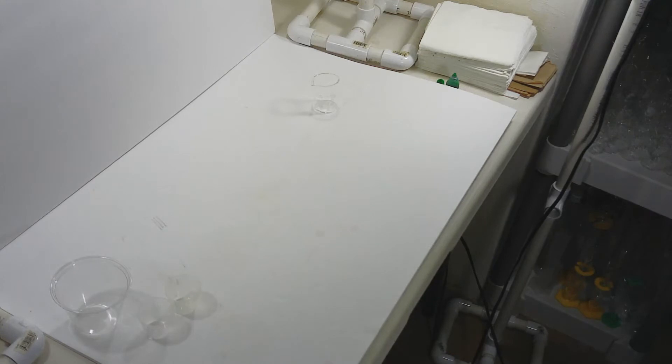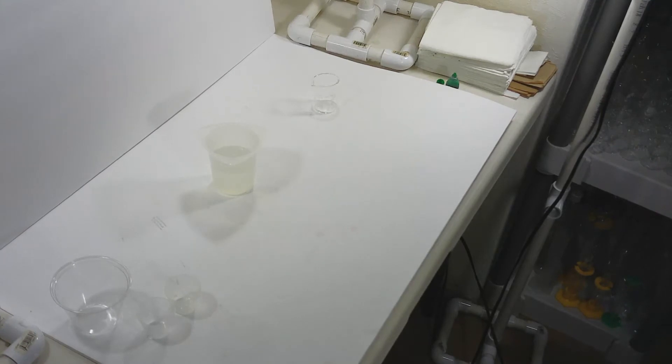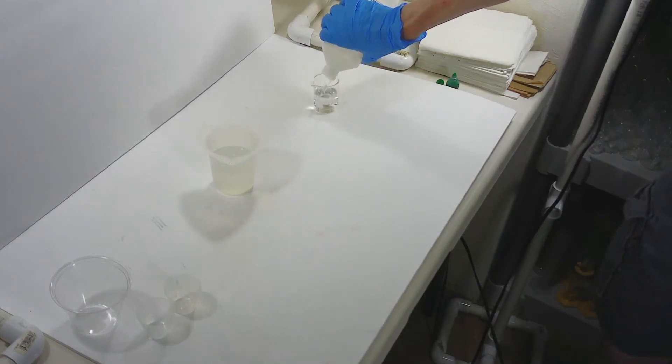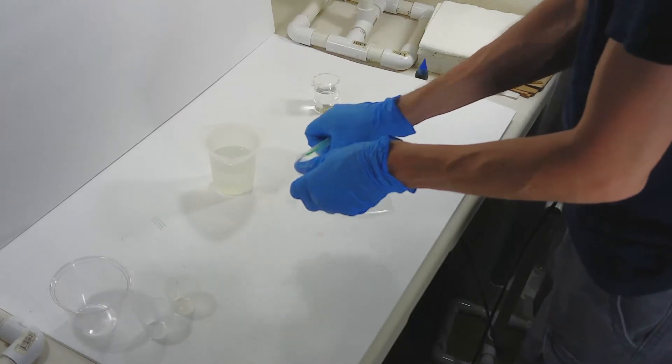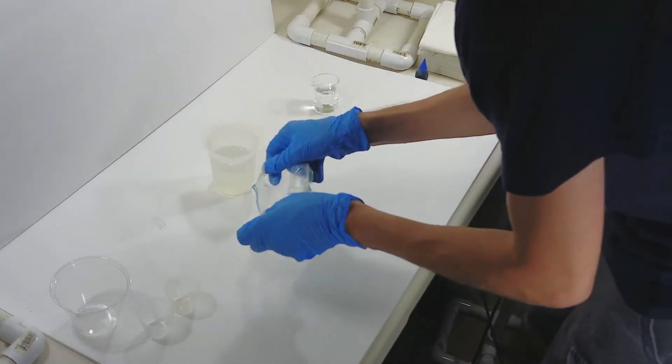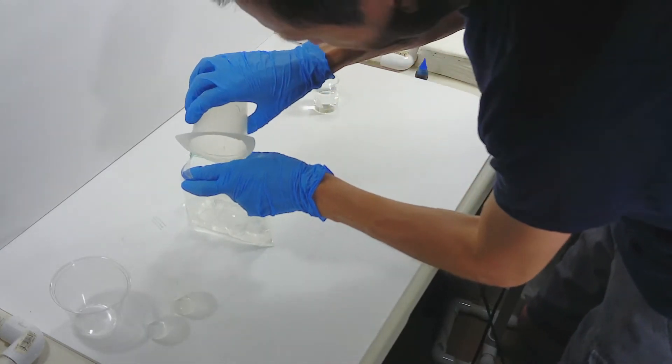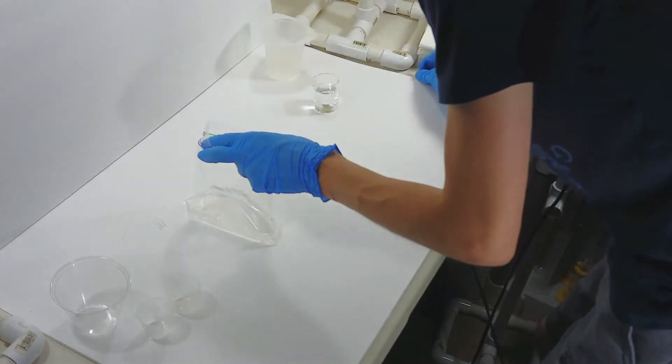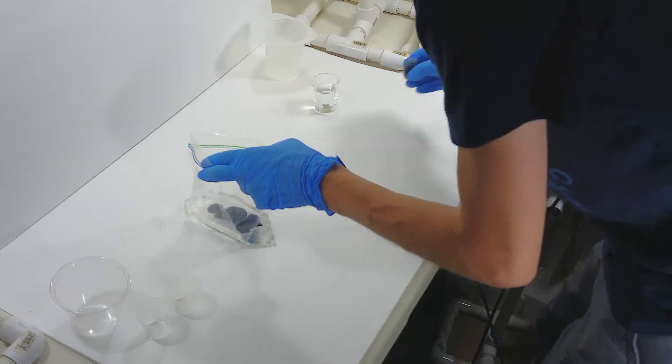As I mentioned before, sodium silicate is also known as water glass. It's basically liquid sand. If it's spilled and allowed to dry, or if it's left in a beaker for a little too long, it's never going to be removed. I've wrecked a few beakers this way over the years, which is why I'm only using plastic or disposable equipment in this video. And why I had to drop everything and make sure that spill got cleaned up in a hurry. By now, especially after the incident, I was pretty much over this procedure. For some reason, I decided to push my luck and make one more ball.